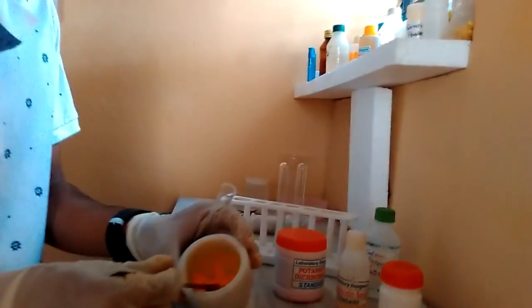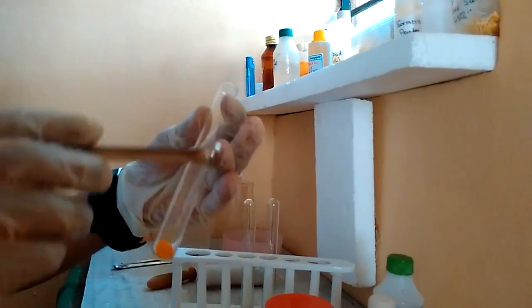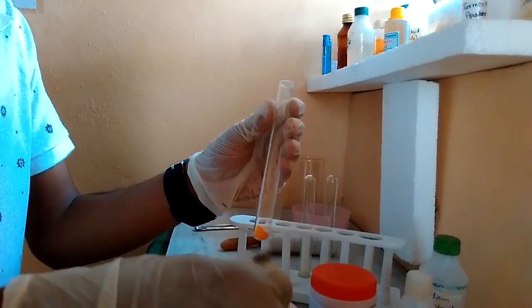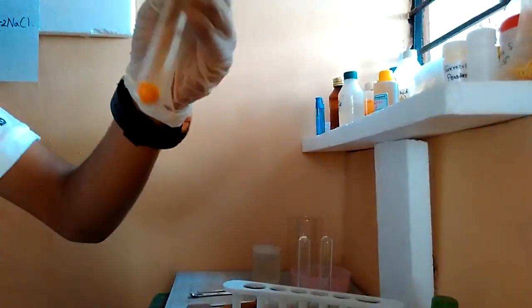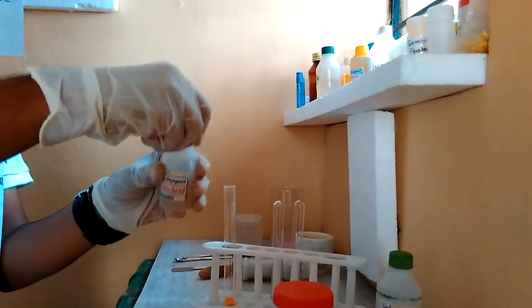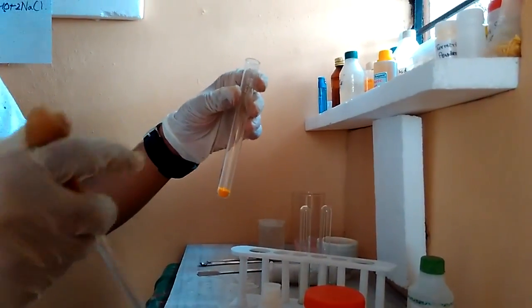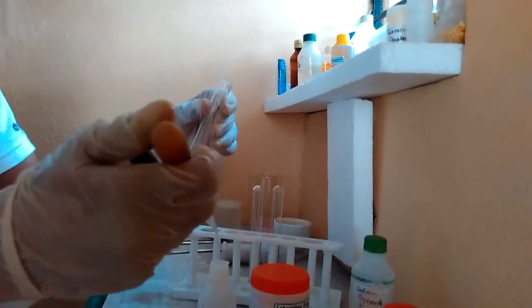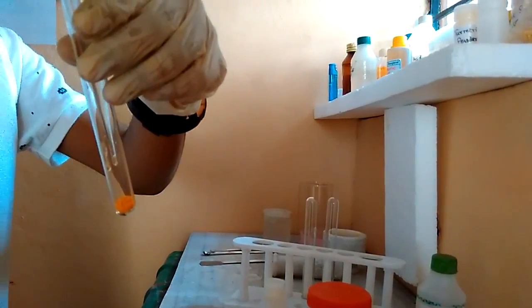You can see that the mixture has a yellowish-orange color. Add this to the test tube, and make sure your test tube is perfectly dry because the chromyl chloride which is produced is hydrolyzed by water. Also make sure your test tube does not have any organic substance in it — ideally use a new test tube. I will now be adding some concentrated sulfuric acid. Make sure you put your dropper well into the test tube and release the sulfuric acid just above the salt.